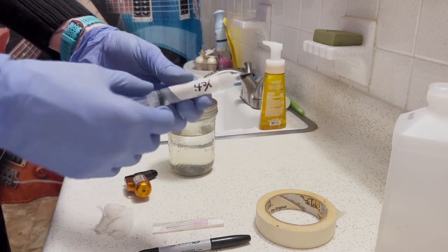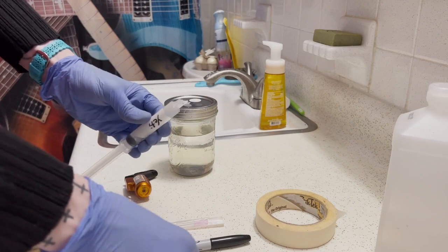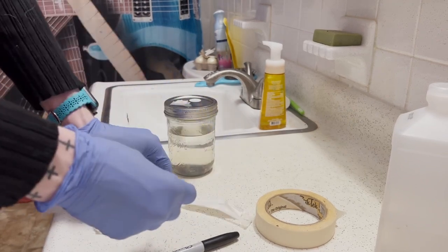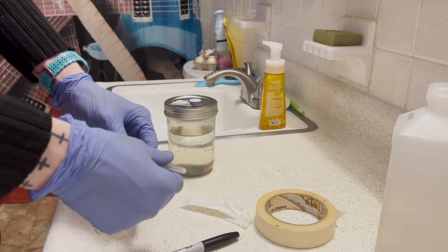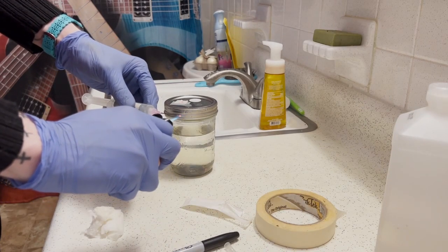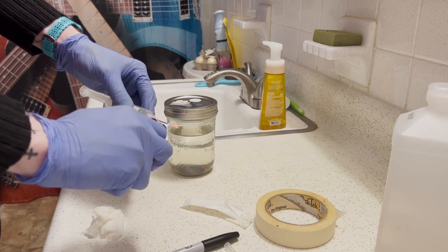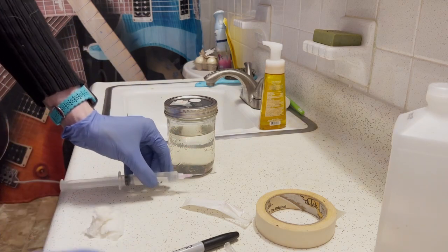I'm going to start by taking off the tip of my Yeti syringe — this is a mushroom culture. Some people say syringes are sterile right out of the package, but I do like to flame sterilize. You don't want to use a lighter — using a lighter will leave black marks on the tip of your syringe, and that could lead to contamination from carbon deposits passing through the syringe tip as the culture goes through.